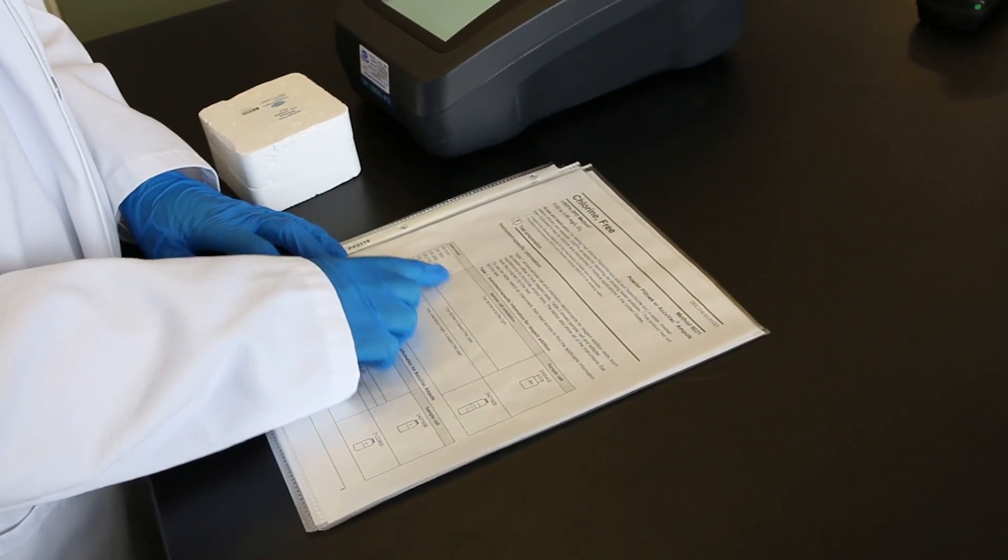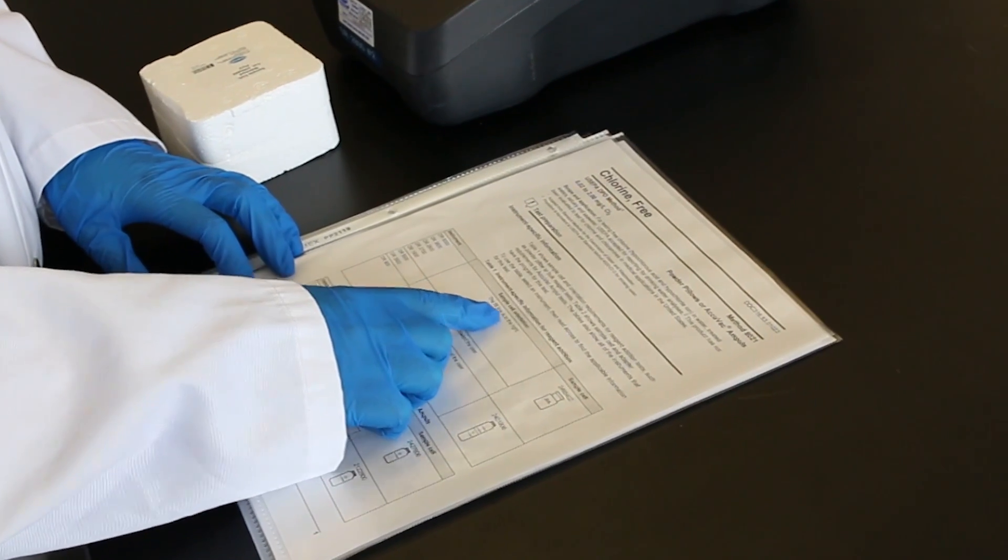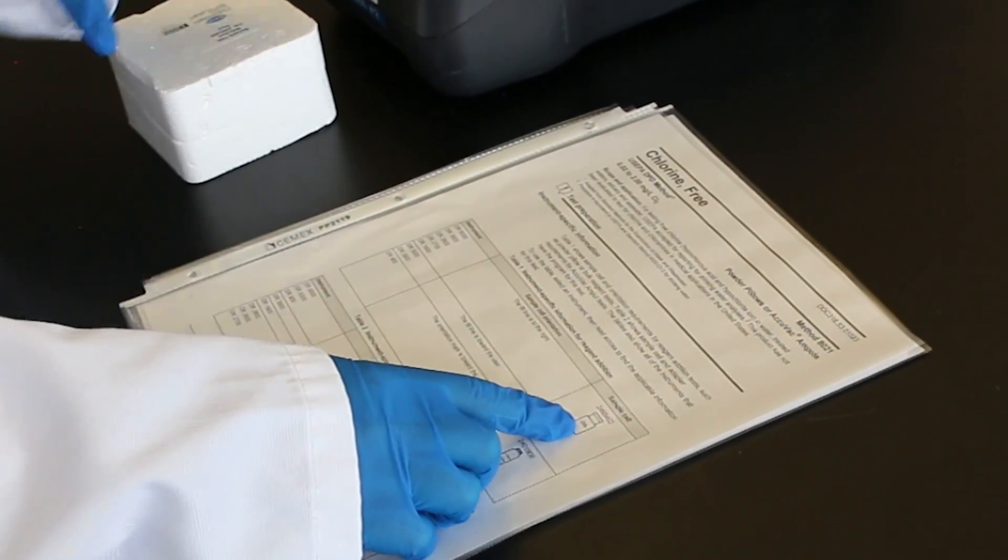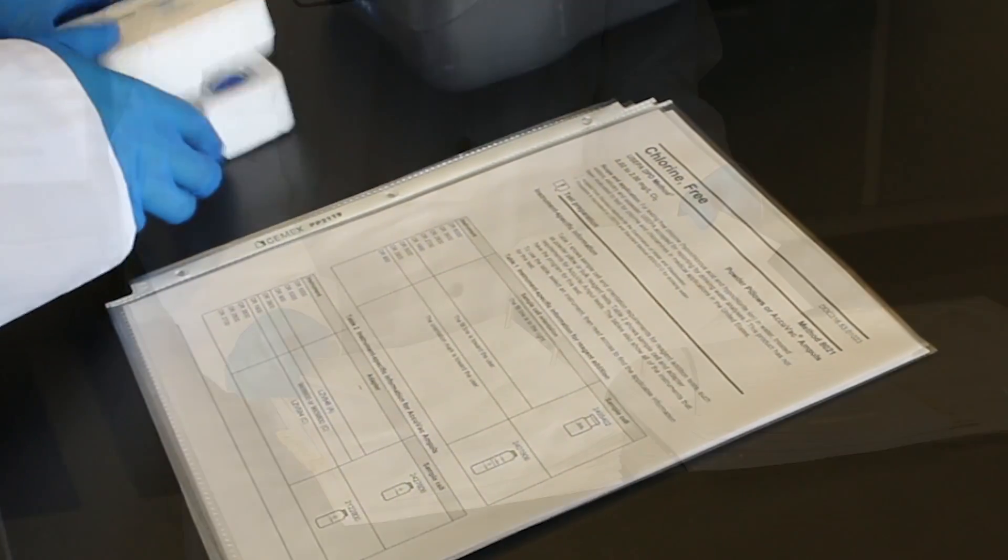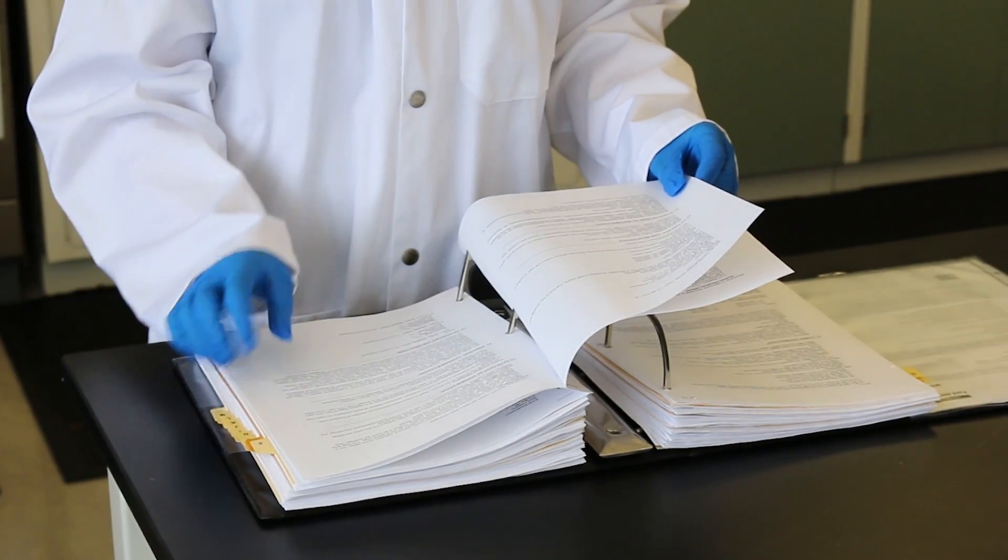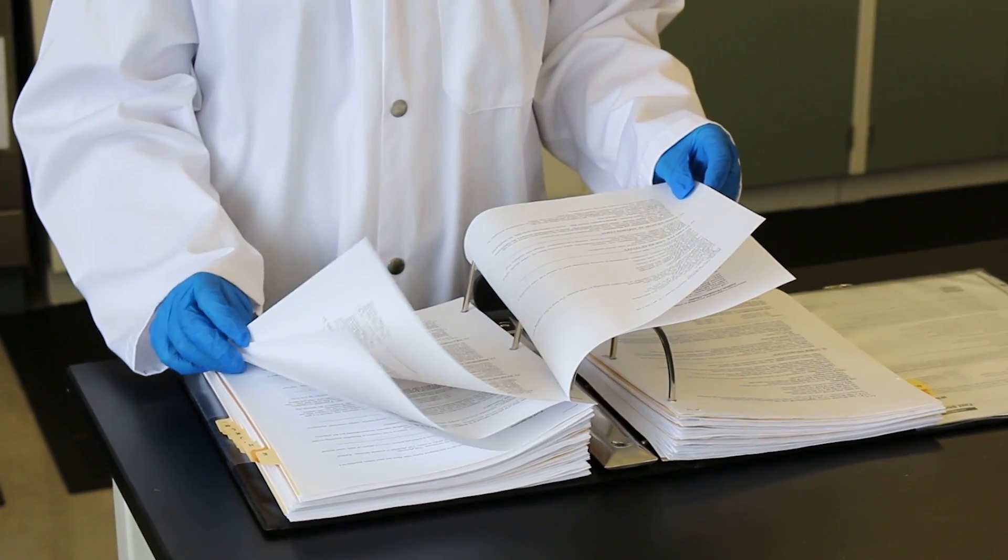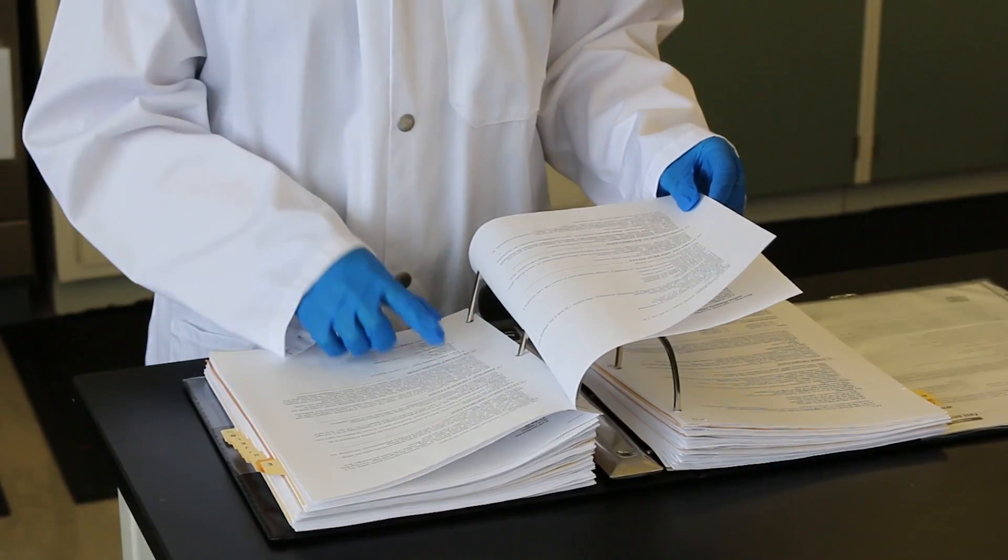A number of interferences exist for this analysis and the manufacturer's method should be fully reviewed before starting the test. It is important to review the safety data sheets for the chemicals that are used and to use the recommended personal protective equipment.